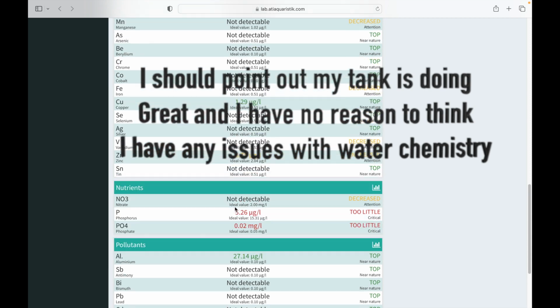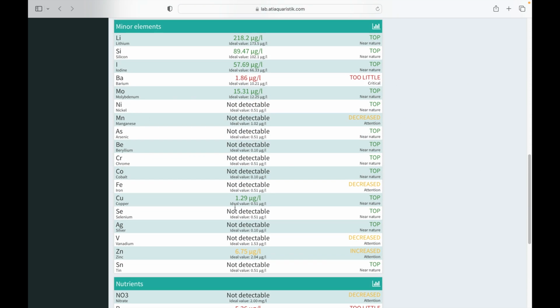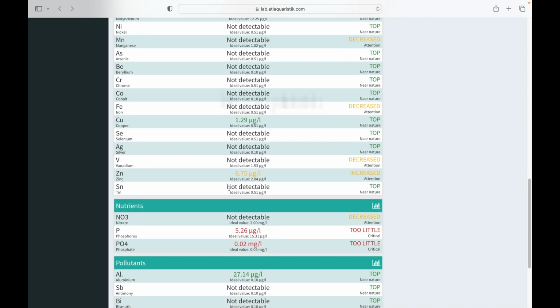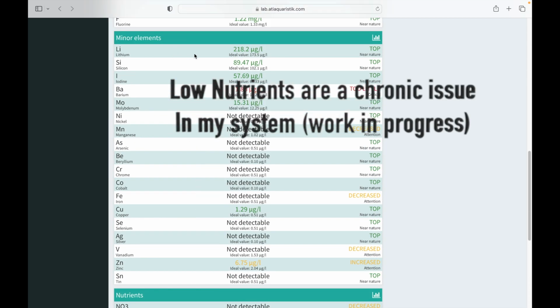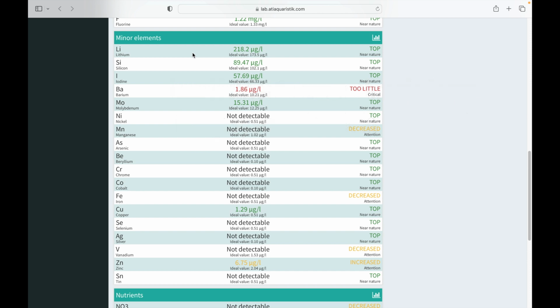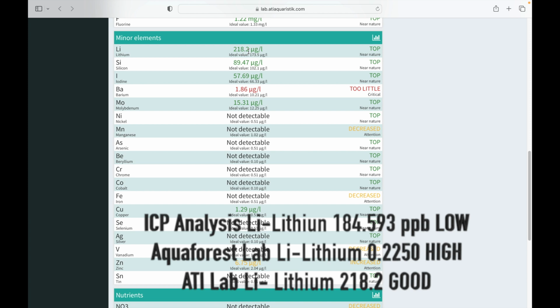Lithium. Let's have a look at lithium. Okay. Down here. Top, that's why I can't see it. Shows lithium is fine. Aquaforest Lab showed this as being elevated too high, actually extremely high. And ICP showed it as low. So ICP says we have to dose lithium. Aquaforest Lab says that we need to stop dosing or there's a problem with the tank because it's too high. And ATI says that it's near nature.